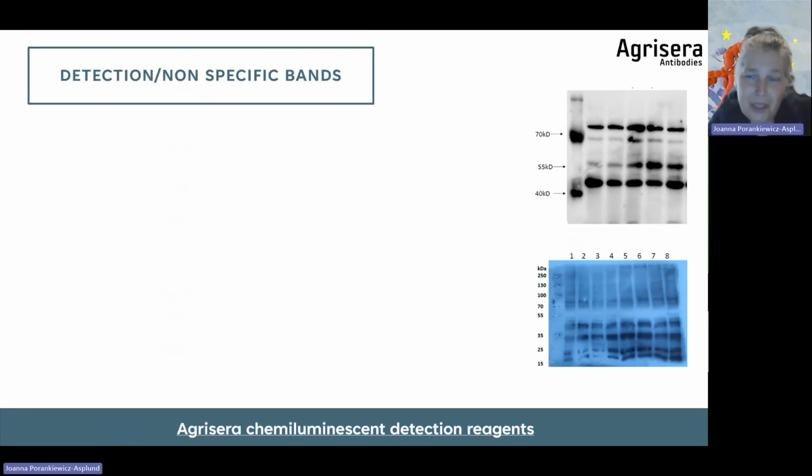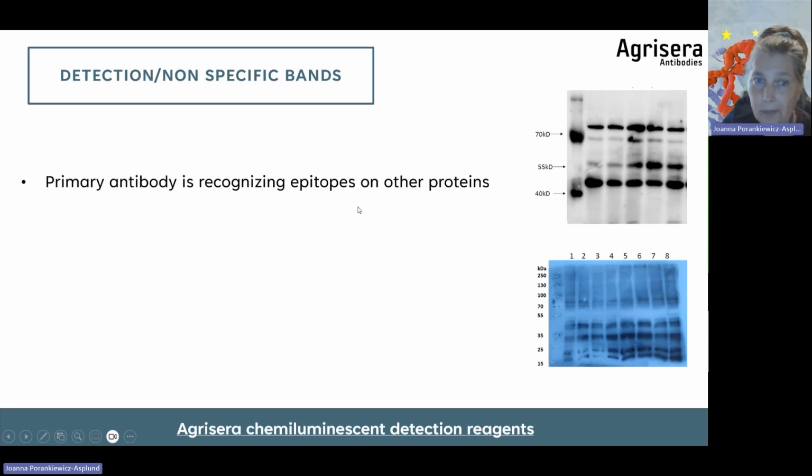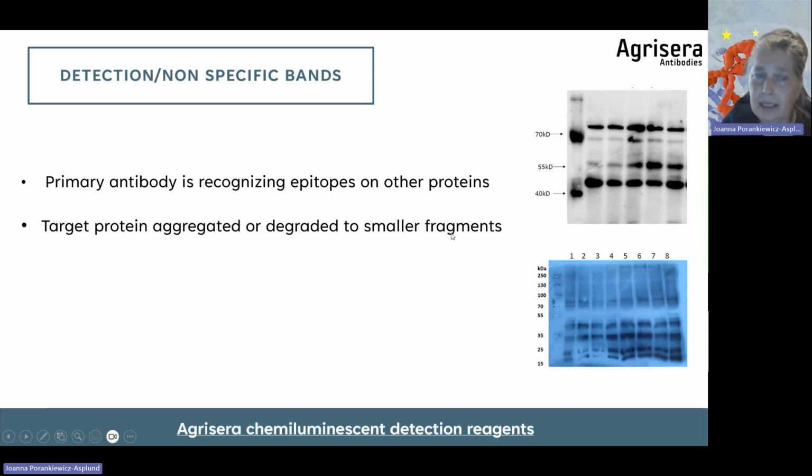And also, what is troublesome in Western blot, these are blots from just last week, which I received. It is non-specific bands, which can appear. This is quite a common problem. So, the primary antibody is recognizing epitopes on other proteins, and therefore other bands are coming up. Target protein may be degraded or aggregated. Especially if antibodies are made to a whole protein, then we have a much bigger epitope pool which the antibody is binding to, and therefore you can have such a ladder pattern.